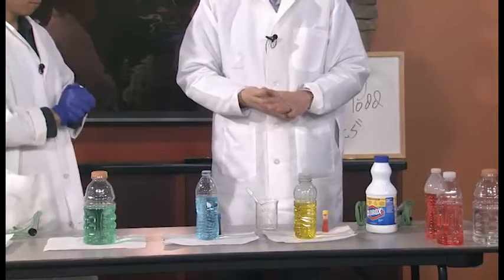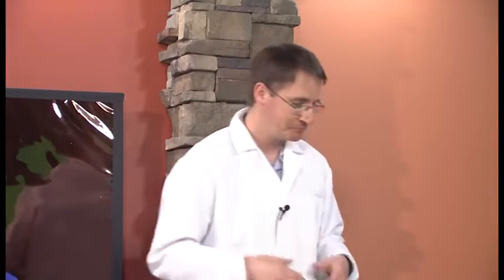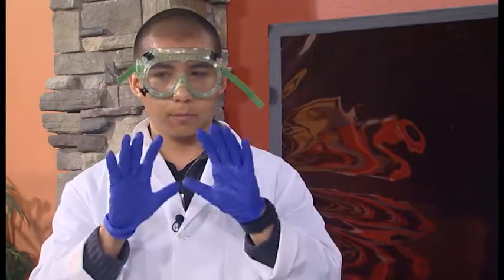Okay, so first things first, safety. Yes. What do we need? Safety. Even though we're dealing with just simply household chemicals, we do want to take into account safety. So we're wearing our lab coats in case we get any chemicals on us that won't stay in our clothing. We have goggles to protect our eyes. Our eyes are most exposed to any sort of chemical. So we'll go ahead and put those on. All right. And then we also have our gloves just to keep the chemicals off our hands if we need to.